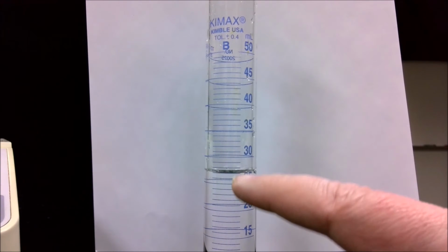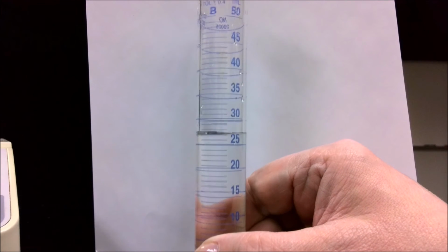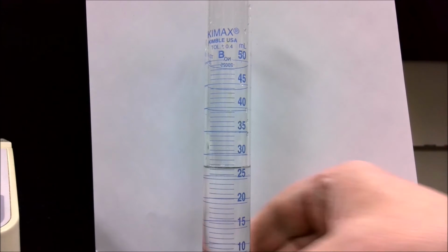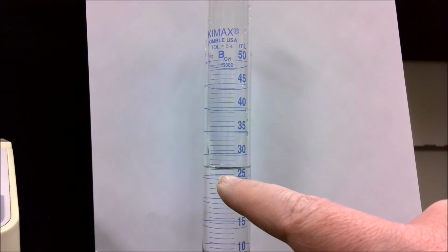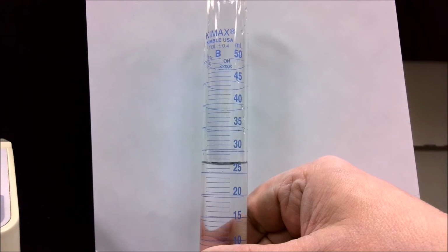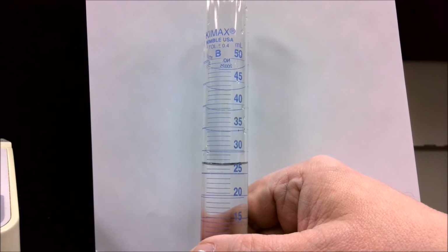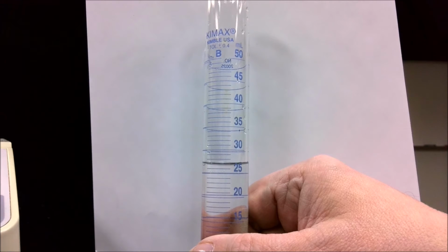All right. So now I've got my meniscus. As typical with a glass cylinder and water, you see the slightly curved surface. We're going to be going for the bottom of that curved surface. So you look right now, here's 25, 26, 27. We want to turn it basically so we don't see the curve, the whole line around the bottom of 25. If we want to rotate it so that that looks like one solid line at 25, that's more looking directly on at eye level.